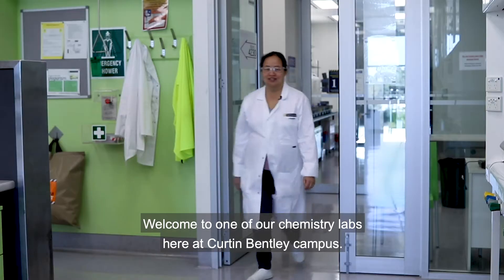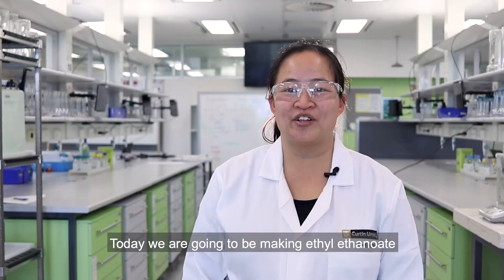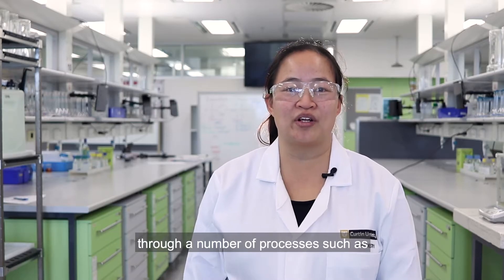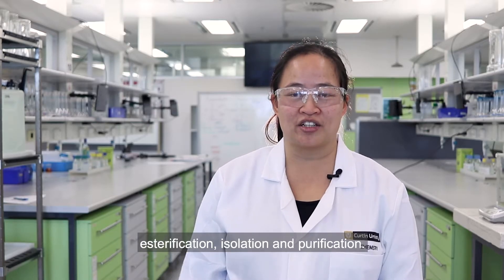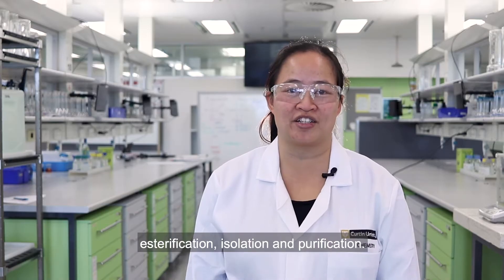Hi, I'm Alexandra Jung and I'm one of the lecturers here at Curtin University. Welcome to one of our chemistry labs here at Curtin Bentley campus. Today we are going to be making ethyl ethanoate through a number of processes such as esterification, isolation and purification.